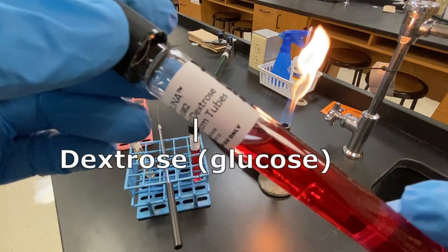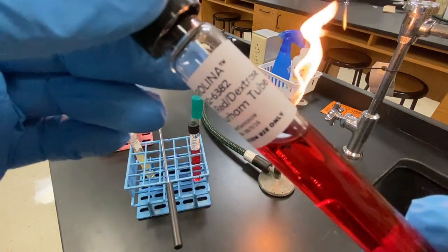This tube is labeled indicating that the media contains dextrose. Dextrose is another name for glucose. This is a sugar molecule, and in this broth it is the only sugar available to the microbes. Some microbes can ferment glucose, other microbes cannot.